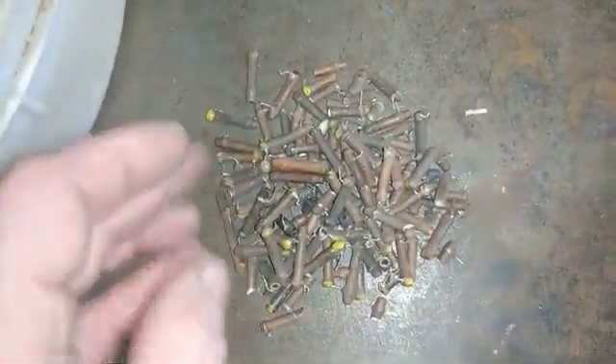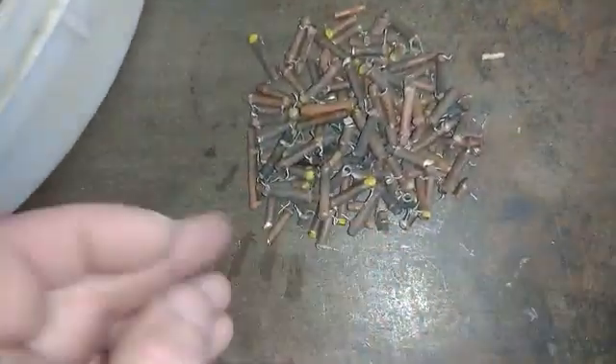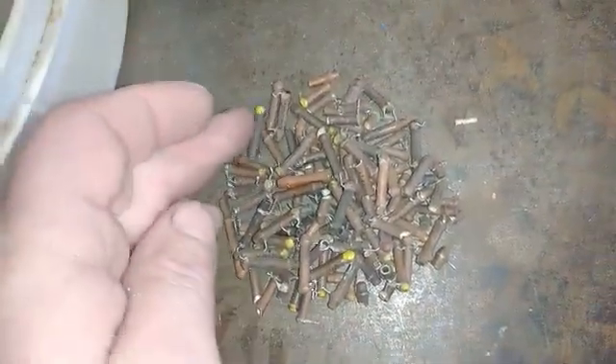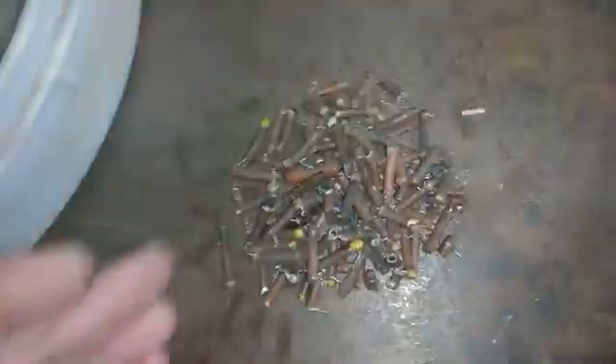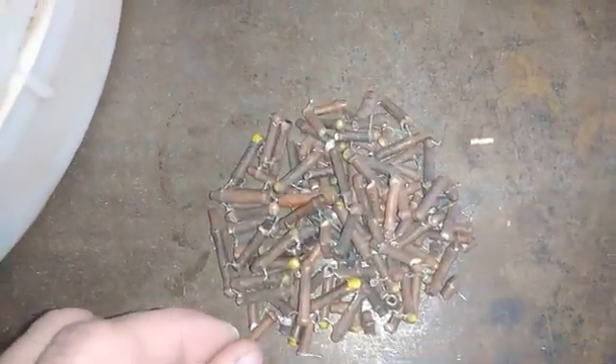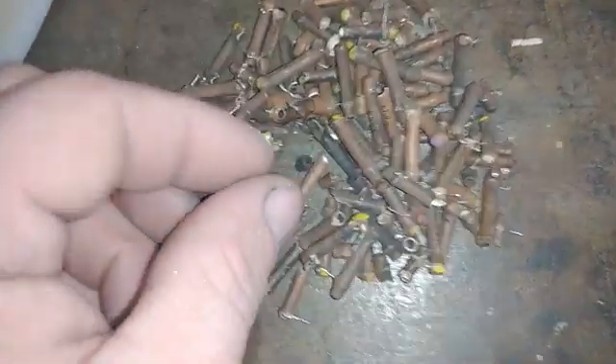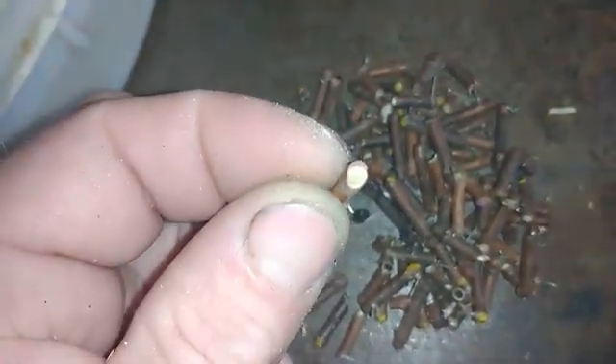This time I will not do any yield, I will just recover some silver from it. Because today I'm bored and I want to do some fun. We'll crack this now and put it in this beaker, add nitric acid, and recover some silver. See that — all this white side is silver.